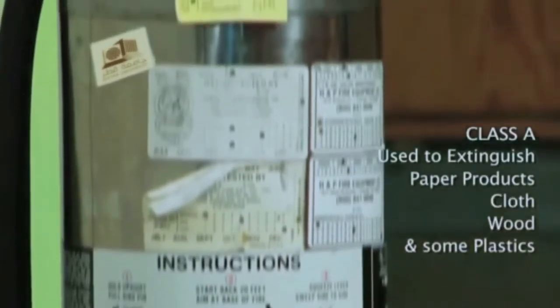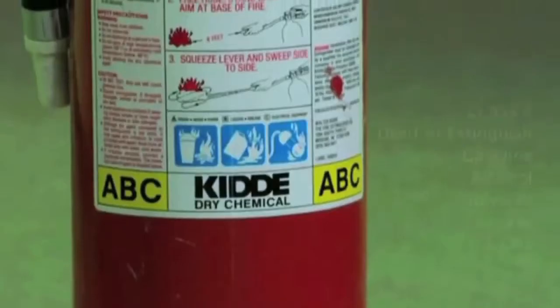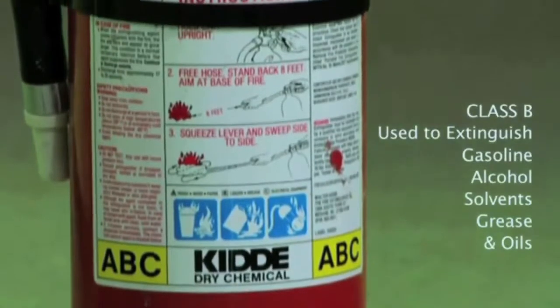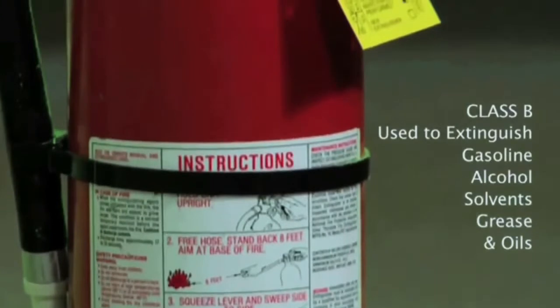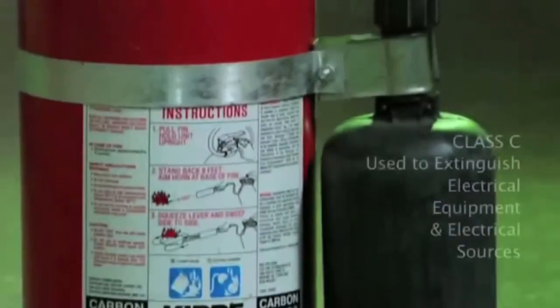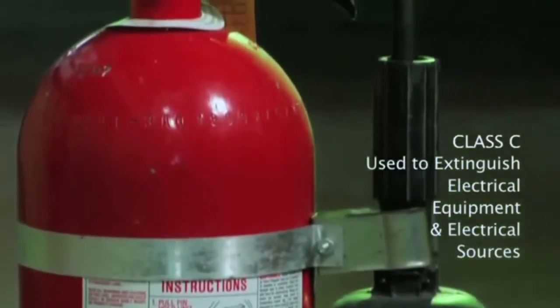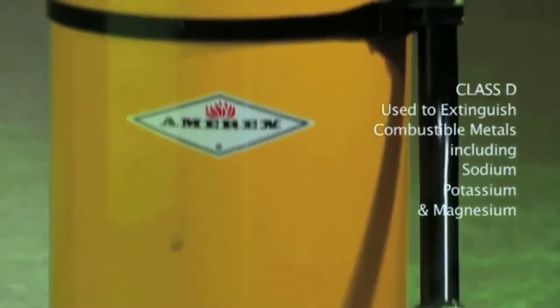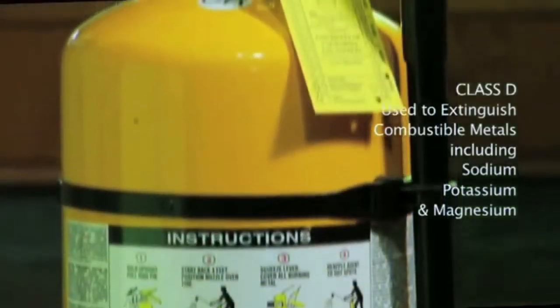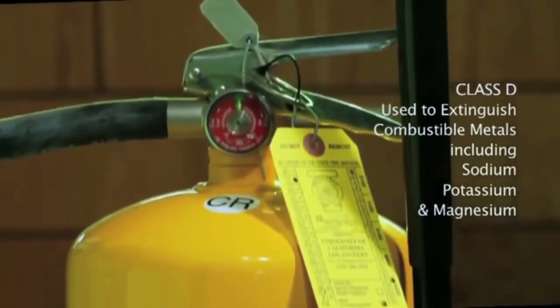Class A fire extinguishers are used to extinguish fires involving ordinary combustibles, such as paper products, cloth, wood and some plastics. Class B fire extinguishers are used to extinguish fires involving flammable liquids or gases, such as gasoline, alcohol, solvents, grease and oils. Class C fire extinguishers are used to extinguish fires involving energised electrical equipment or an electrical source. Class D fire extinguishers are used to extinguish fires involving combustible metals. Materials in this category include sodium, potassium and magnesium.